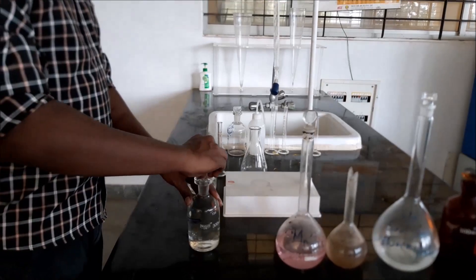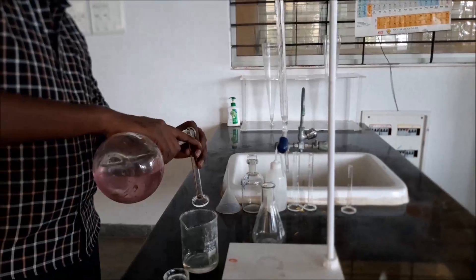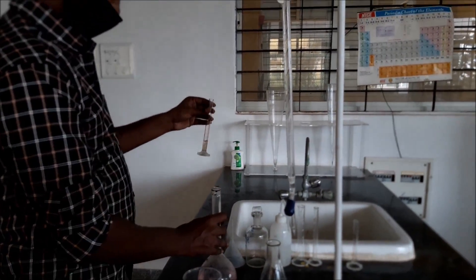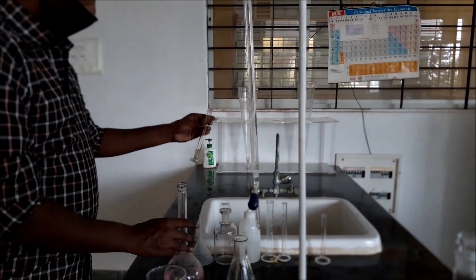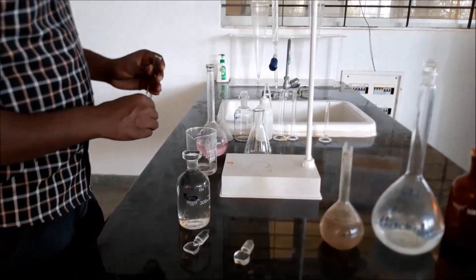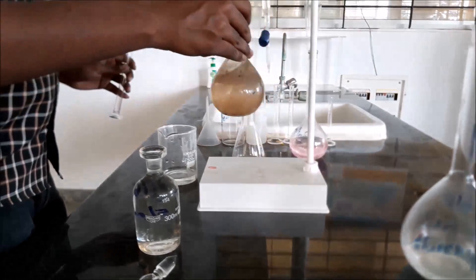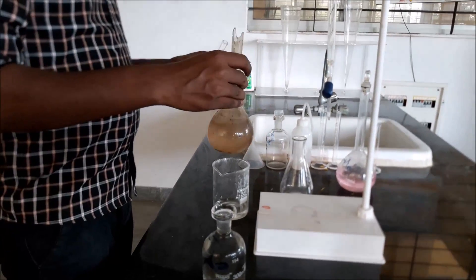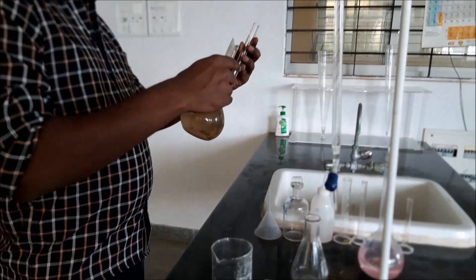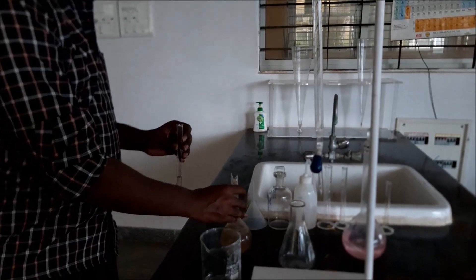Now, the reagents — that is manganese sulphate and alkali iodide azide — 2 ml each will be added. 2 ml of manganese sulphate is measured and added to the sample. Then 2 ml of alkali iodide azide is measured and added to the sample.